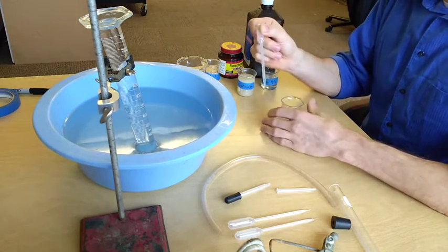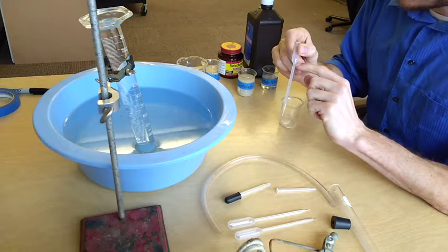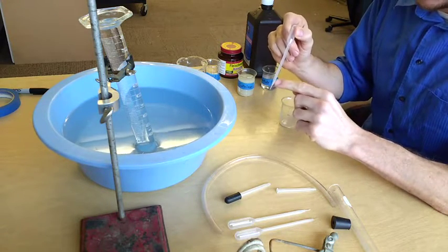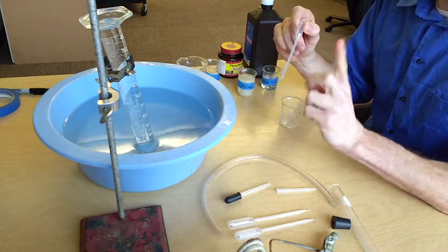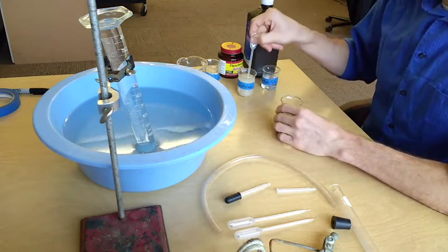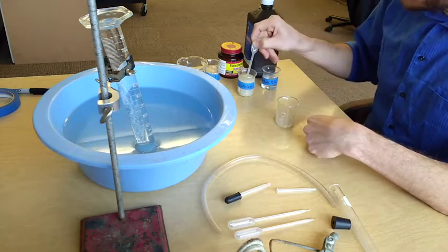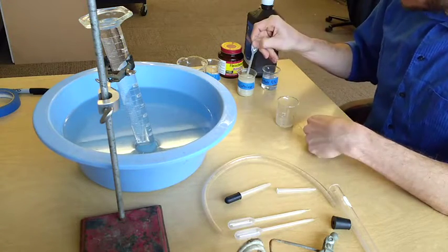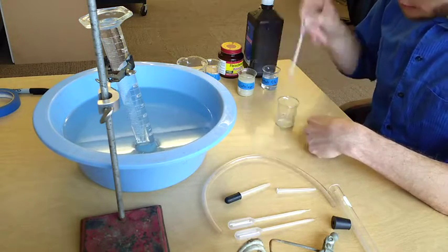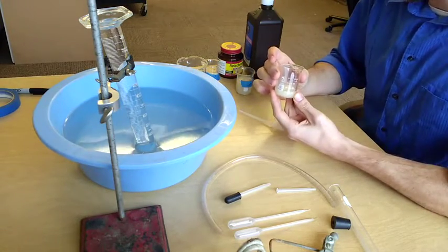To do that, with a pipette, right at the corner here, there's a little line and it should say one milliliter. So the container up to that corner in this pipette measures one milliliter. And so you can put 10 milliliters into your environmental container. Now let me do that real quick. Okay, so now I have 10 milliliters here.